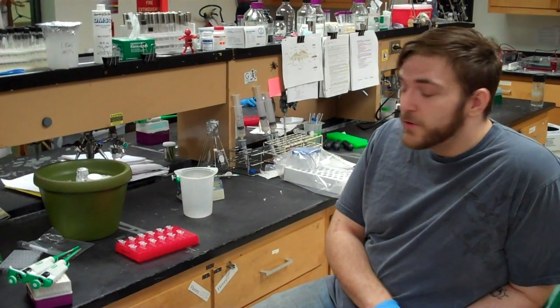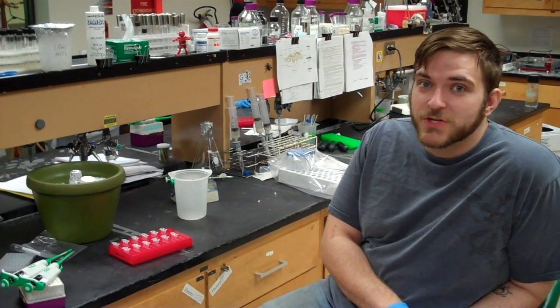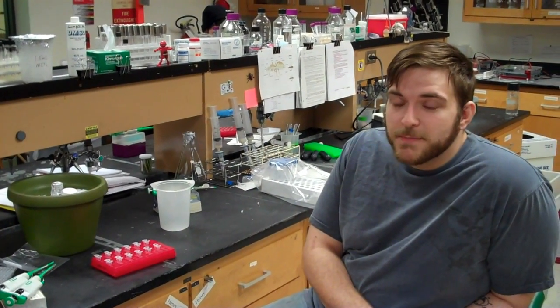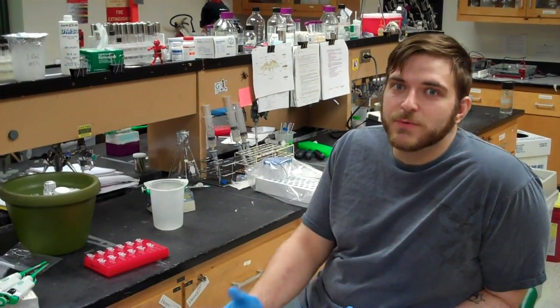Hi, my name's Henry, and I'm currently doing an ethanol precipitation, which is a very important step in the entire gene sequencing, DNA sequencing process.